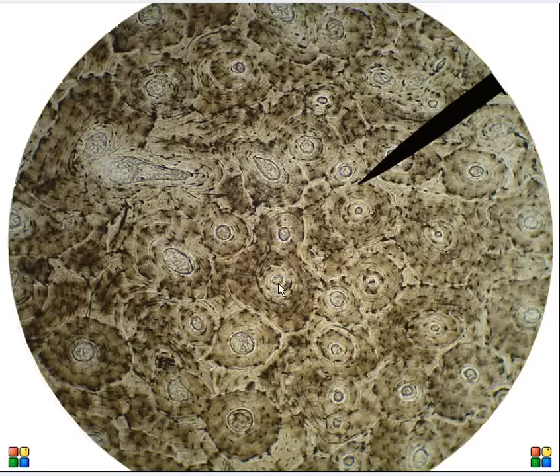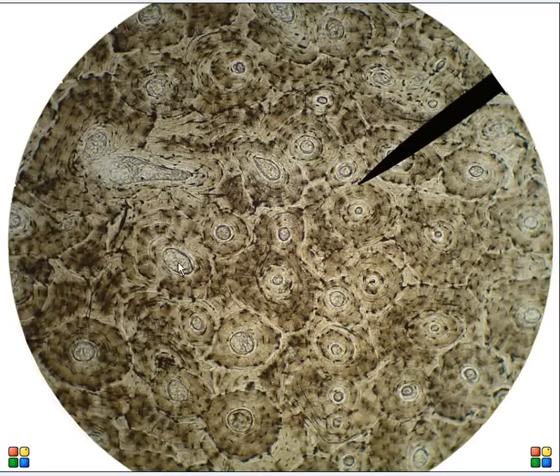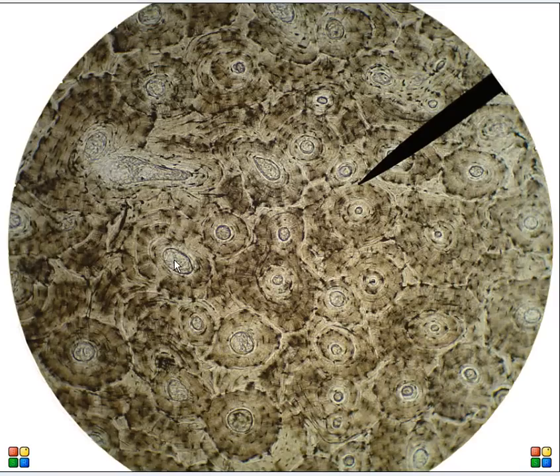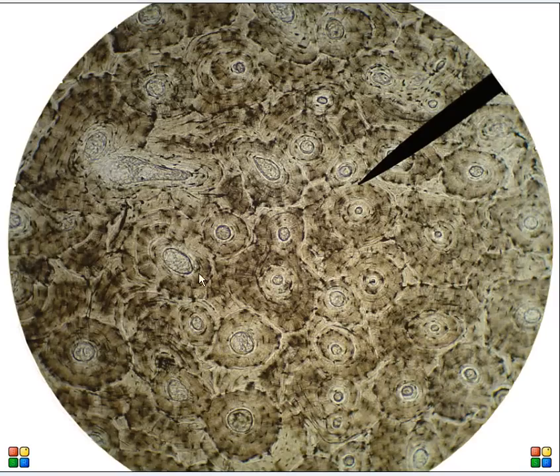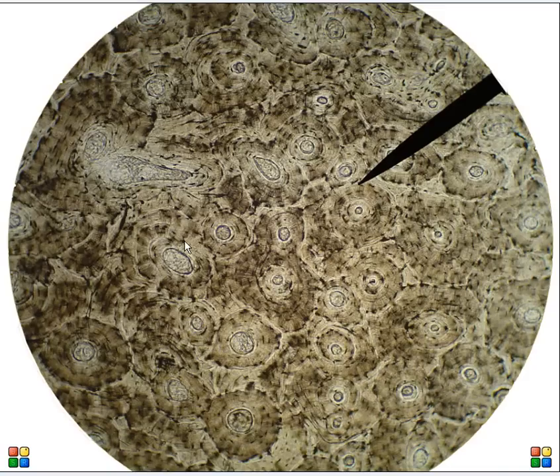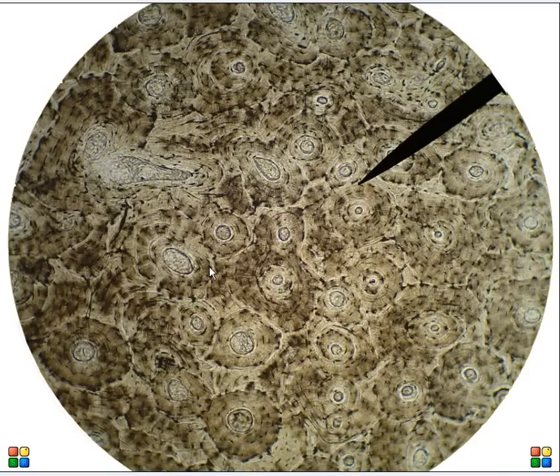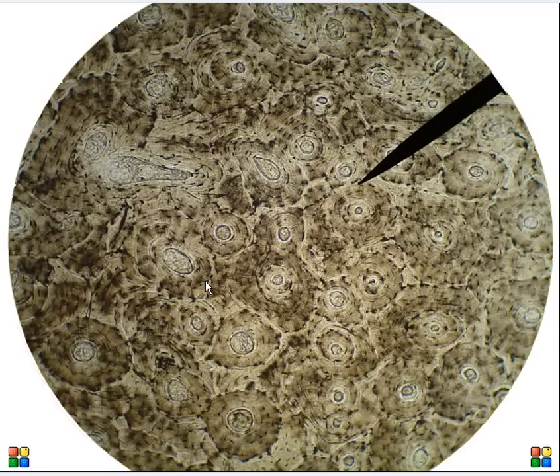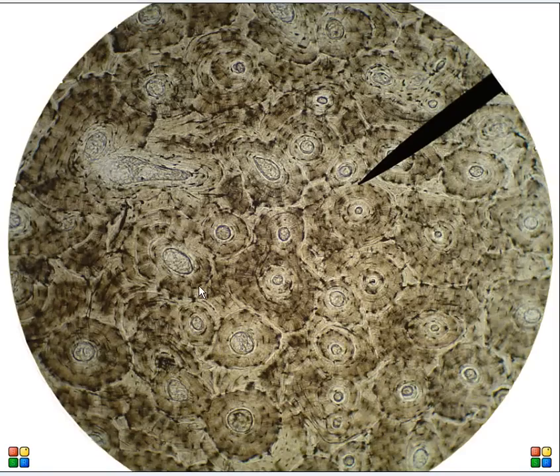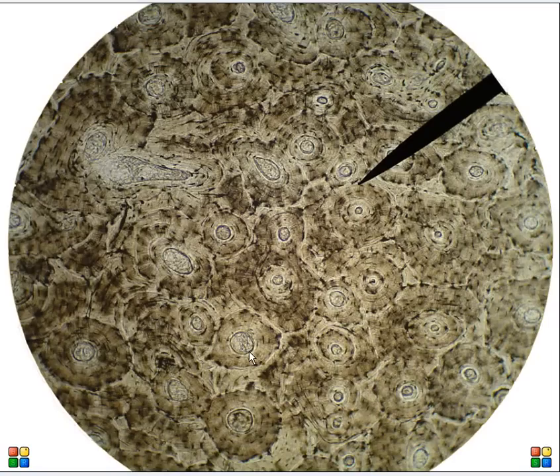At this magnification we start to see some of the structures of the osteon. In the center of the osteon is the central canal. The layers that give it that tree ring appearance are called lamellae, and you can see these little dark dots — those are the spaces that the bone cells live in. The bone cells are called osteocytes, and the spaces are called lacuna (singular) and lacunae (plural).